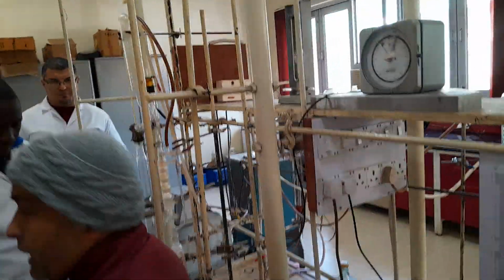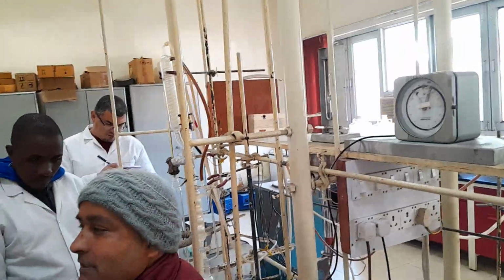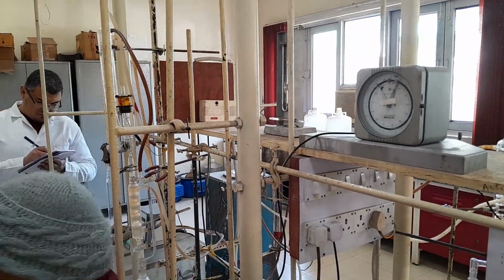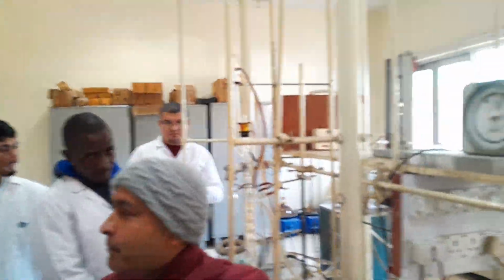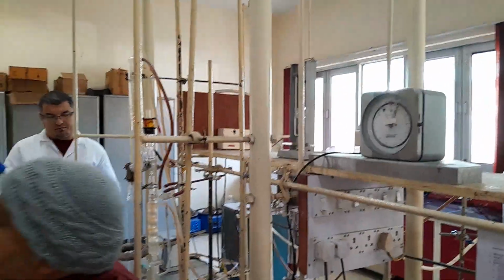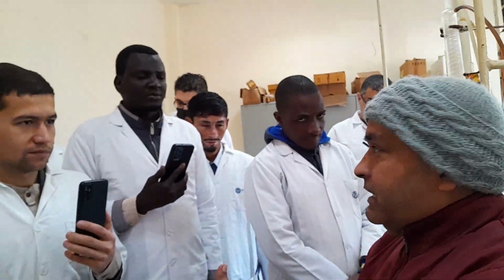Now, second is FBP, final boiling point. Here again the question arises: what is the difference between the FBP by fractional distillation and the FBP by D86? Again, it will reverse. Your FBP will be lower in D86, but the FBP in fractional distillation will be higher, because, as I told you, you have a fractional distillation and a feed behind it.